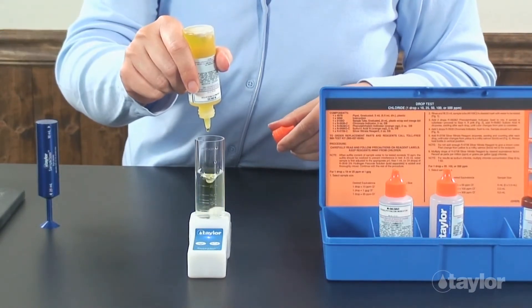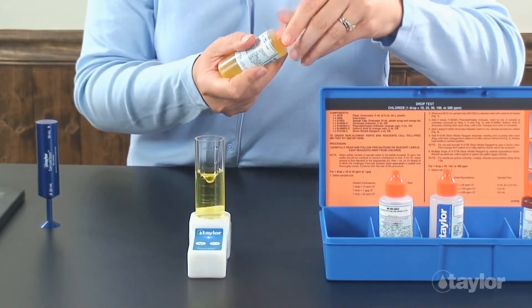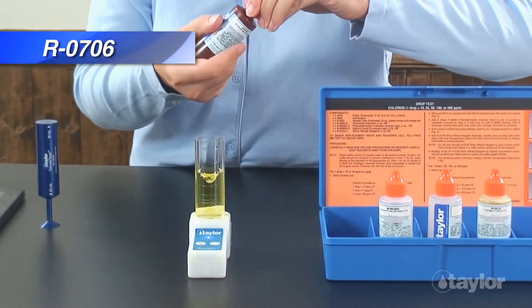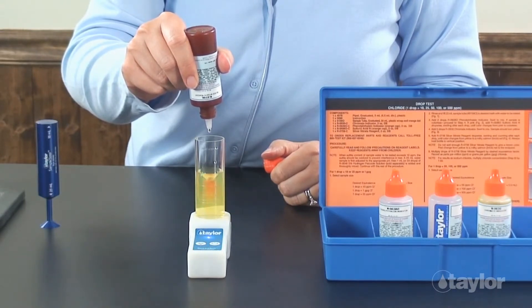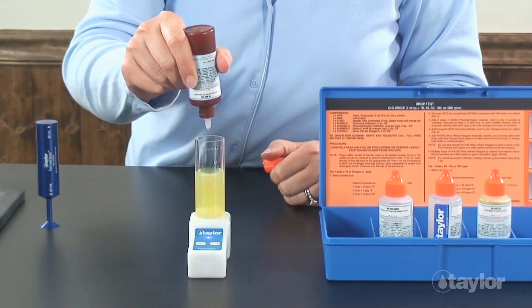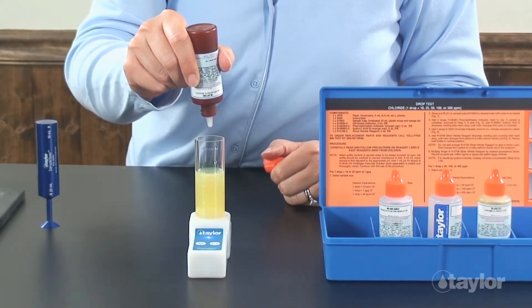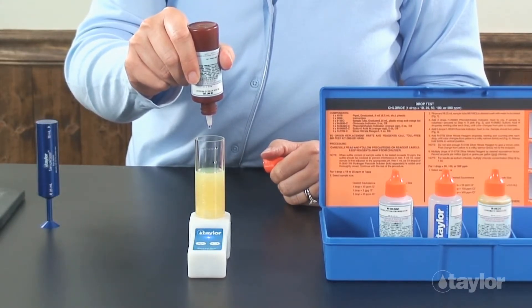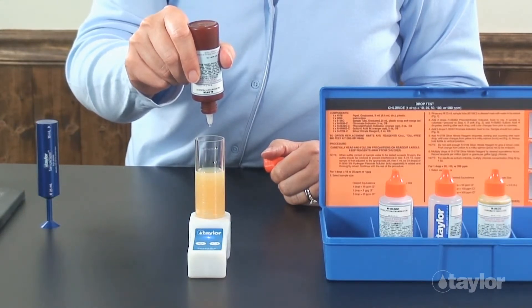Add silver nitrate reagent dropwise, swirling and counting after each drop, until the color changes from yellow to a milky salmon or brick red. Note: do not add so much silver nitrate reagent that the sample turns brown. It is important that the color change goes from yellow to a milky salmon or brick red, which signals the endpoint.